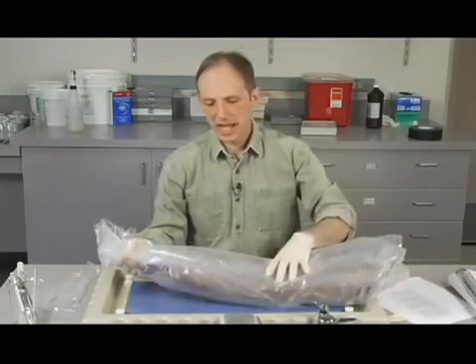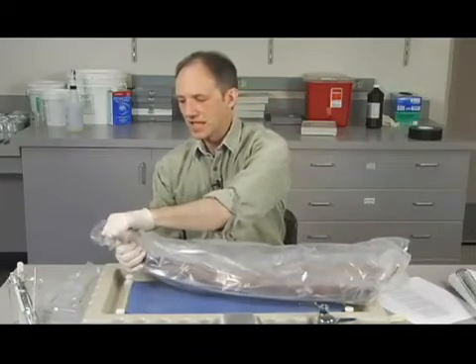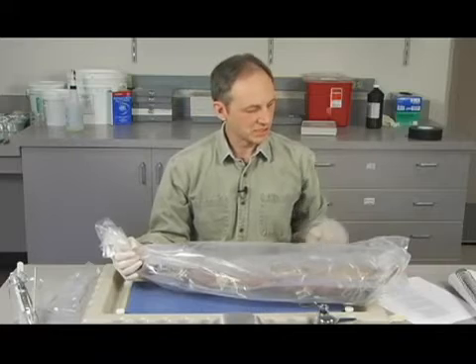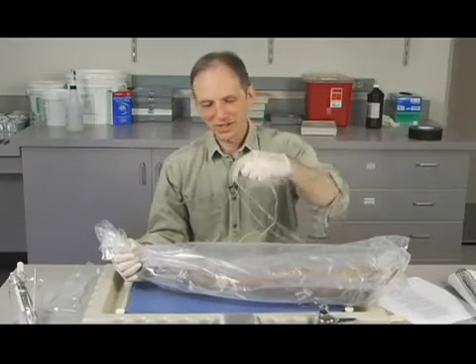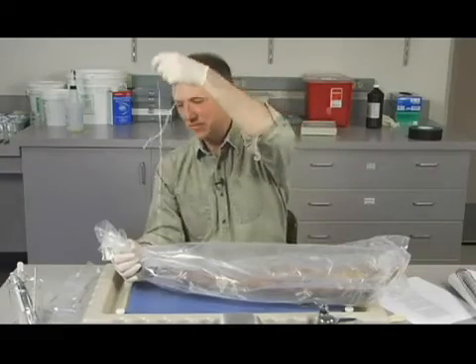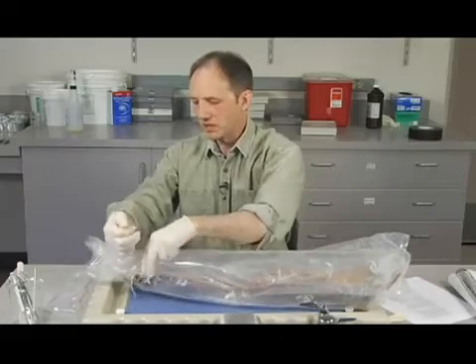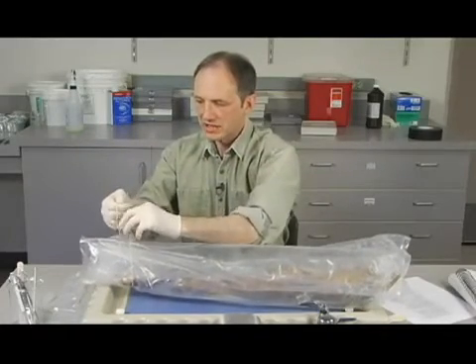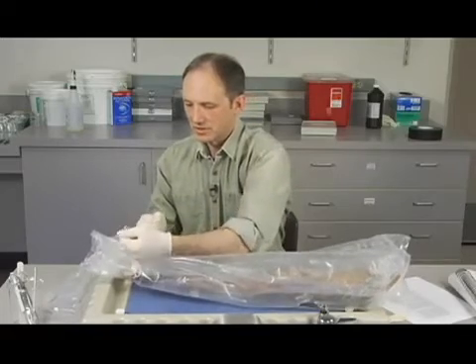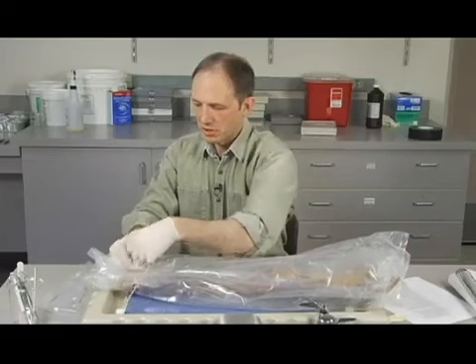To finish up with the cat, you do want to tie it. It's not like a resealable lunch bag or something like that, although that would be nice. We don't have that. We're going to use some string, and I'm just going to put it around the edge of the open end of the bag. See how this works here? And really just tie it any old way you tie your shoe. Put a little bow in here.